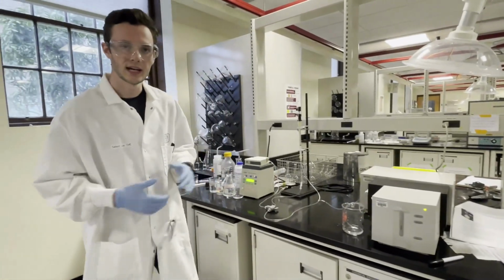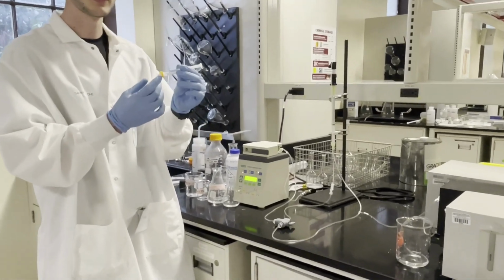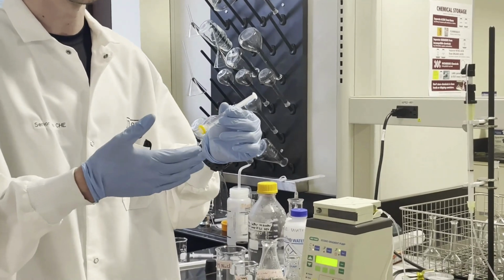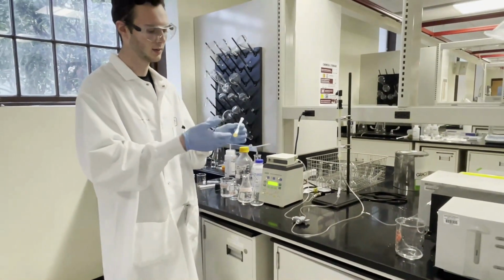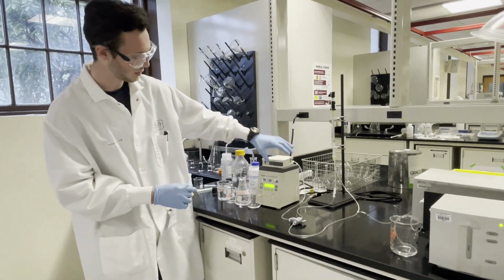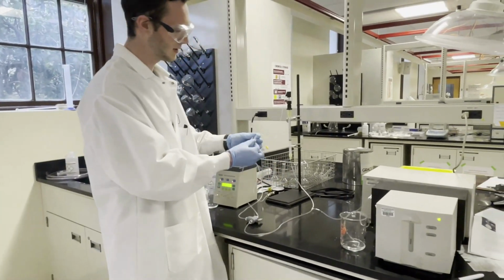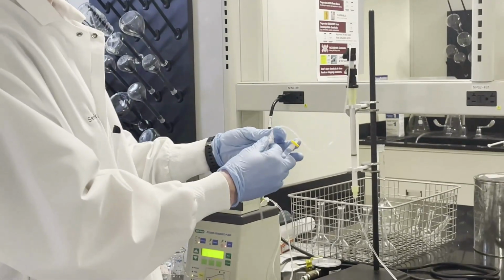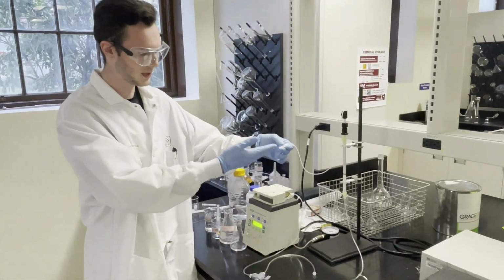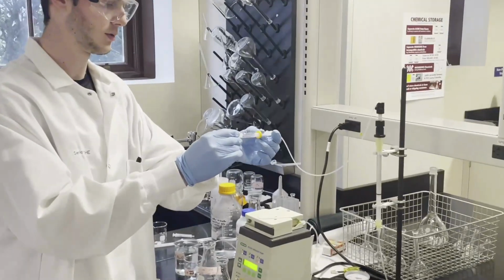The way that we're going to add our proteins to this system is through the use of a syringe. You can see on the end of the syringe here, we have a filter to make sure that any impurities that we obtained during the development of the proteins do not get passed into the column. So we're going to disrupt the flow of the loading buffer by turning off the pump. And then we're going to manually disconnect at this joint here to be able to connect our syringe. So now that we've disconnected the tubing, we're going to take our syringe and apply it directly into this opening.